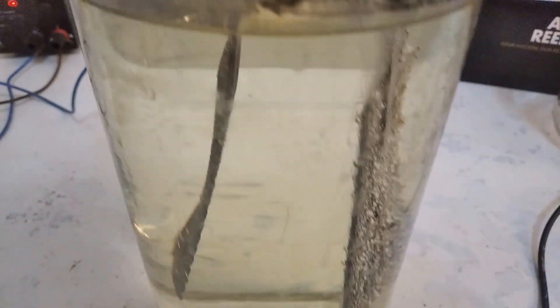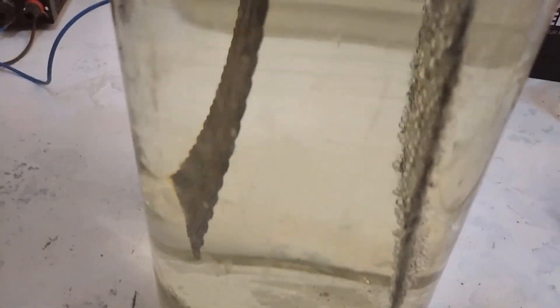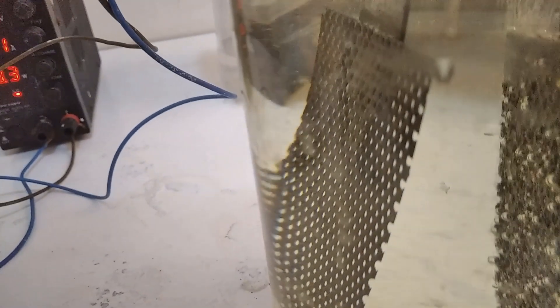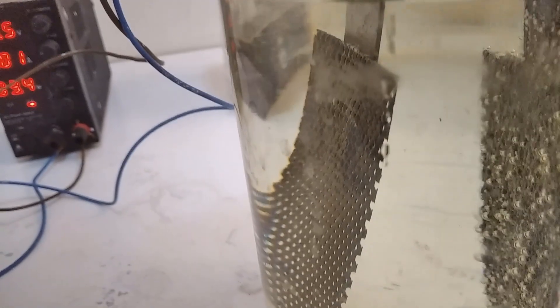We're off to a great start already. We can see that there's no brown cloud appearing over here. However, I think our titanium is forming hydrides, so I have to switch this out for a different electrode, probably something like steel.